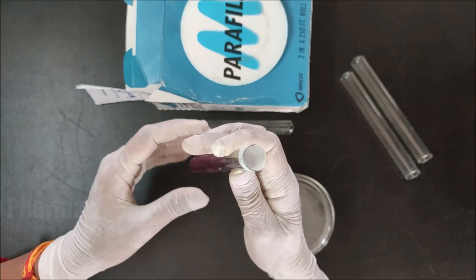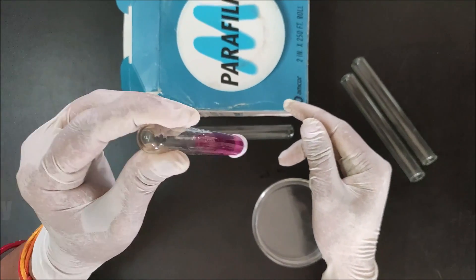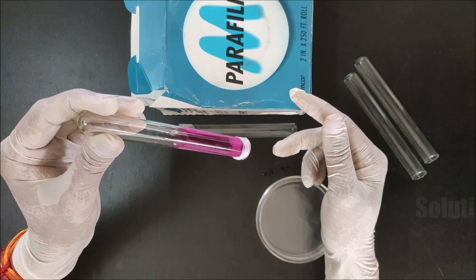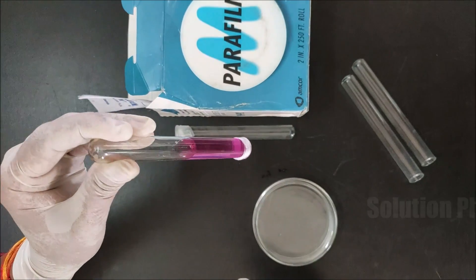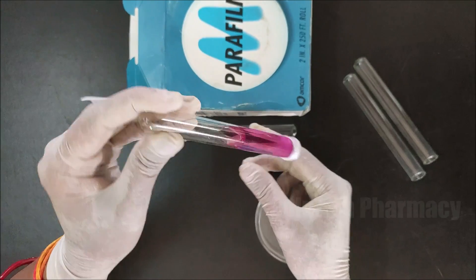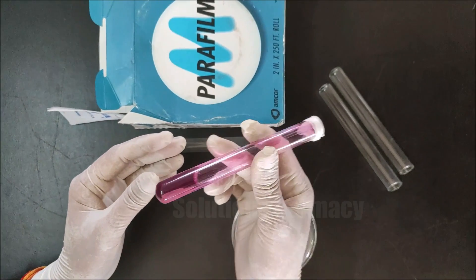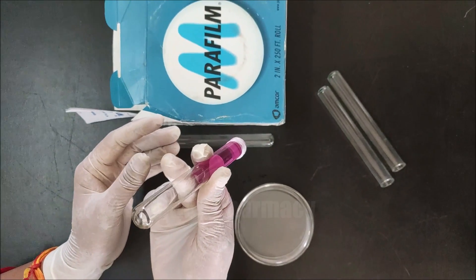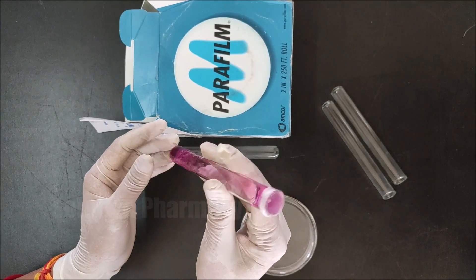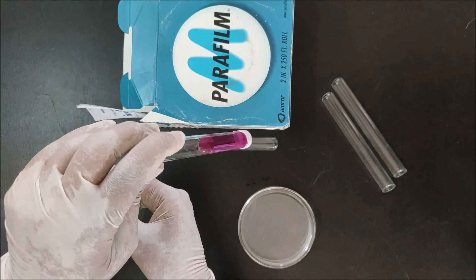The test tube is now sealed properly using parafilm. The liquid will not leak out — here we have completely inverted the test tube and you can see the liquid is not coming out. You can also mix the contents by turning the test tube up and down, or store a liquid-containing test tube for a long time to prevent entry of moisture or contaminants from outside.